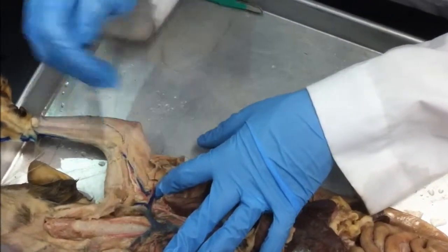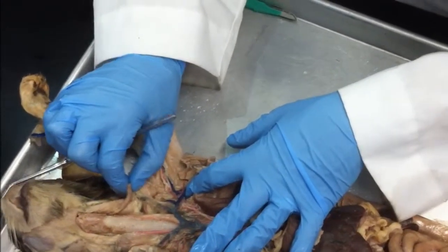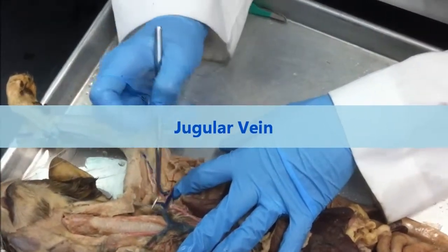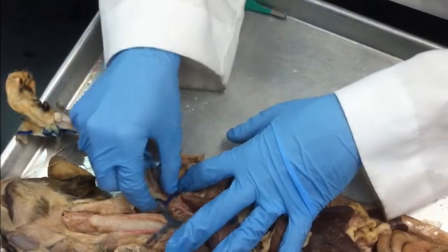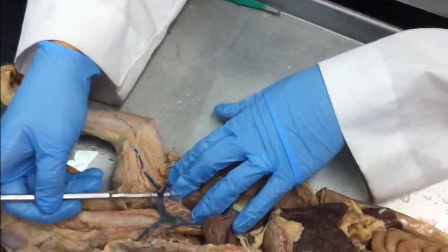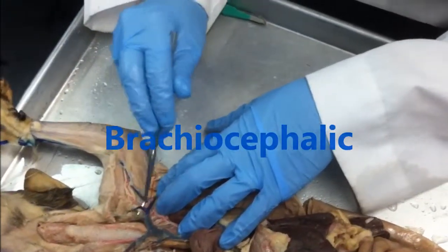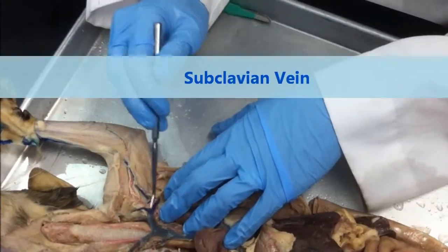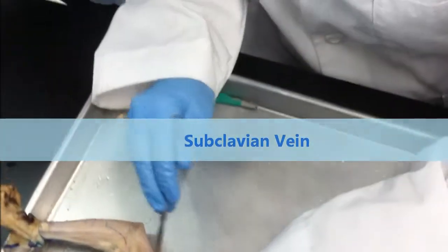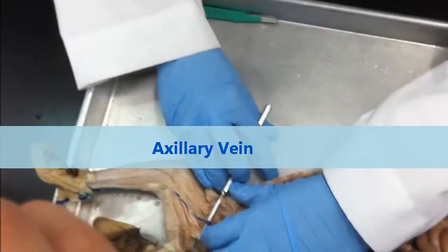Okay? Cephalic. What's going up to my cephalic region? Jugular vein. Okay? So from brachiocephalic to the jugular vein. Splitting away from my brachial region, right? What do I have here? Axillary. This is still brachiocephalic. I tricked you. Okay? Going behind the clavicle, what's that one? Subclavian. Okay? Subclavian splits off to this vessel, which becomes the axillary.